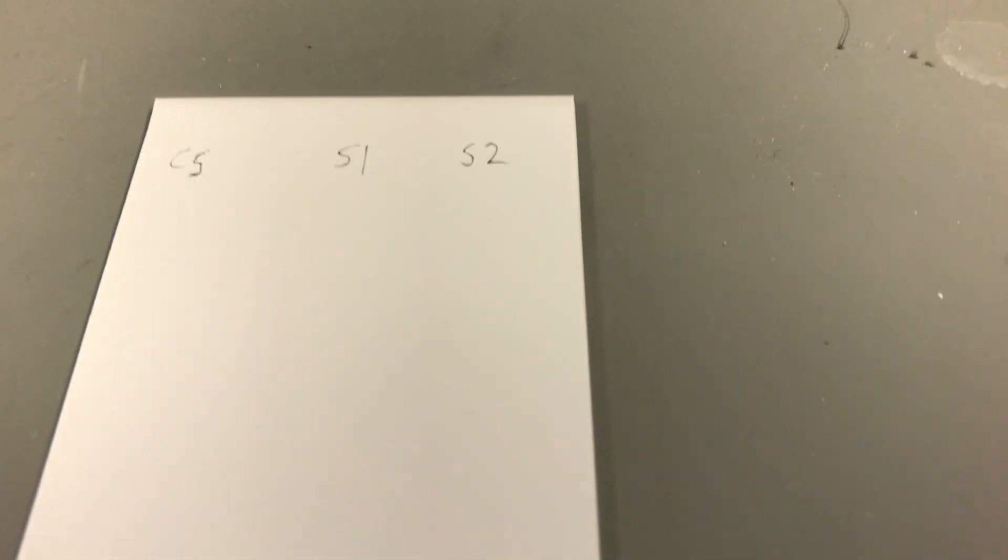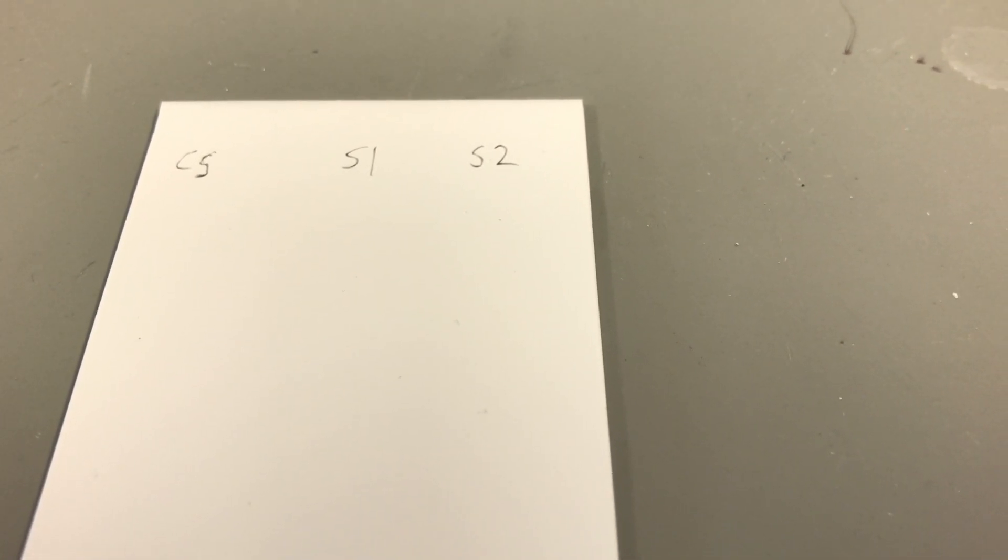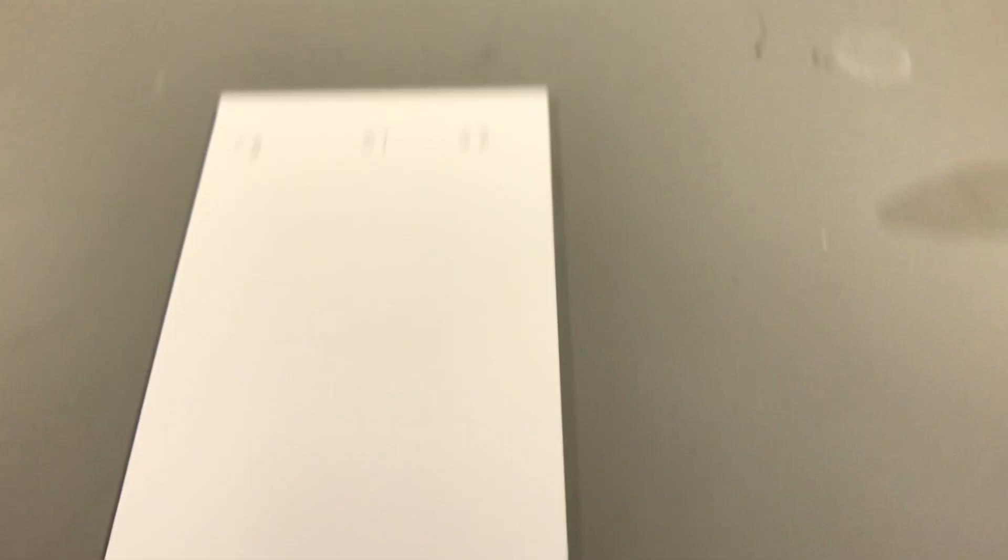All of these labels and this line were made with a pencil, not a pen. Why a pencil? Well, the pencil won't dissolve in the solvents and travel up the plate like the pen would, because the pen is made up of organic materials.